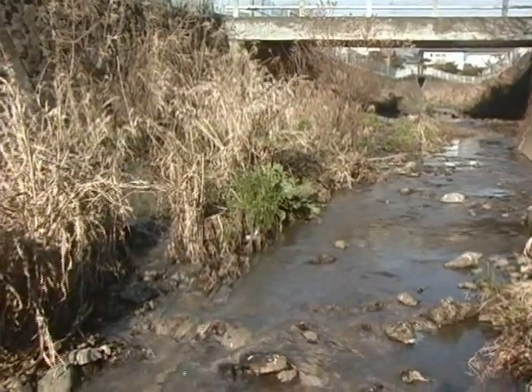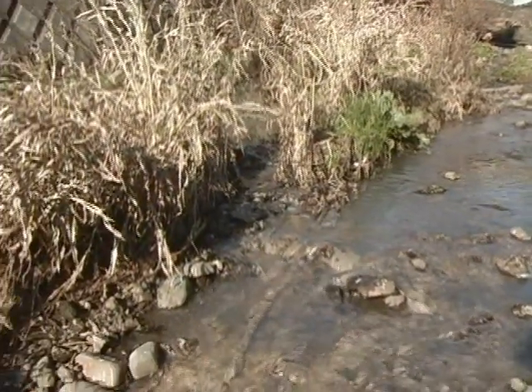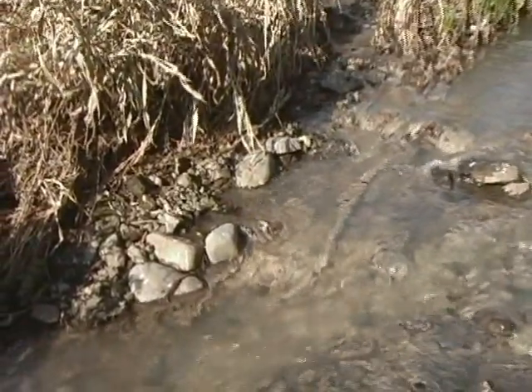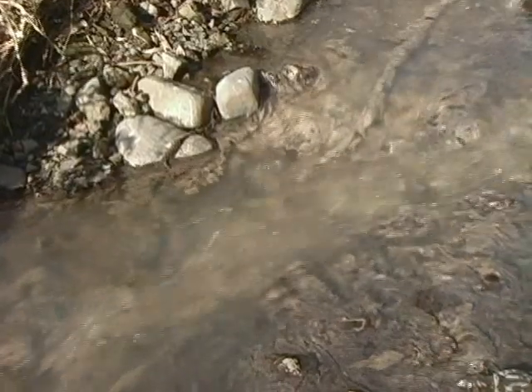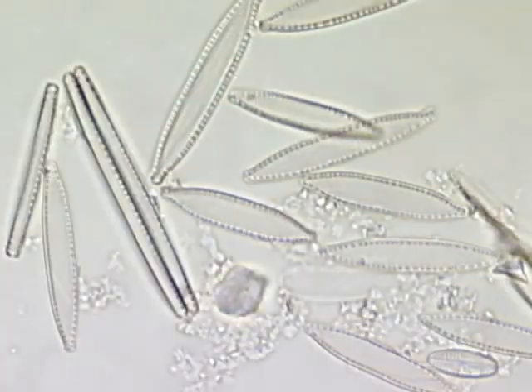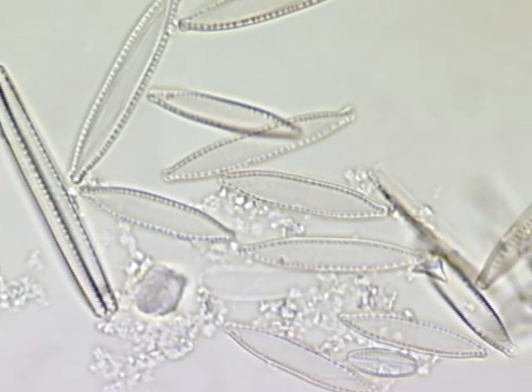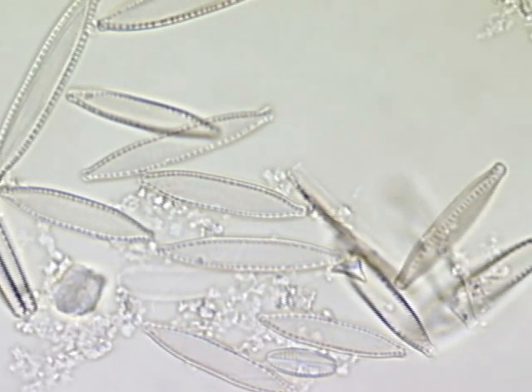Could there be diatoms in this type of water? Let's collect and clean a sample of this water and view it under a microscope. Yes, even in such severely polluted waters, diatoms are able to exist.